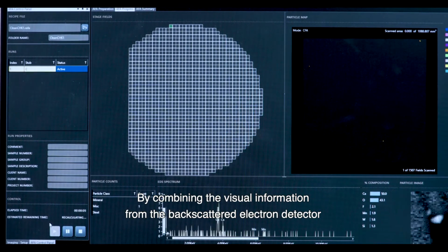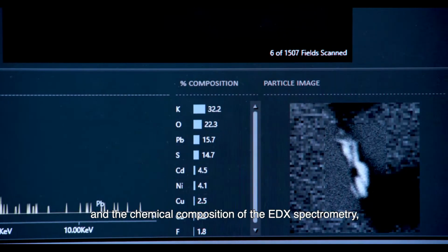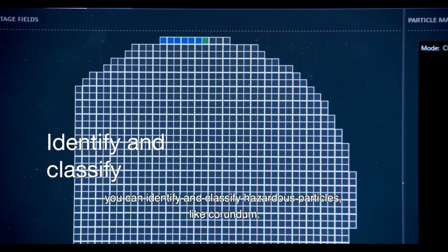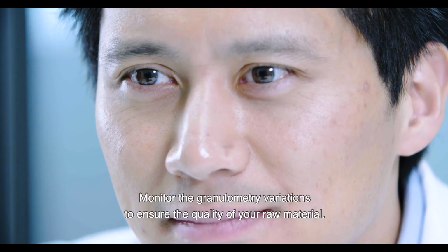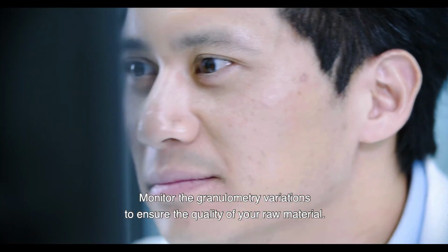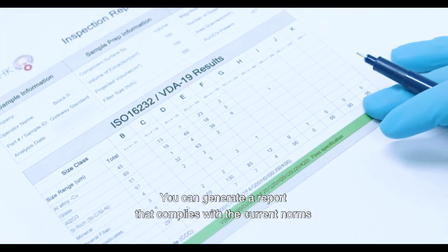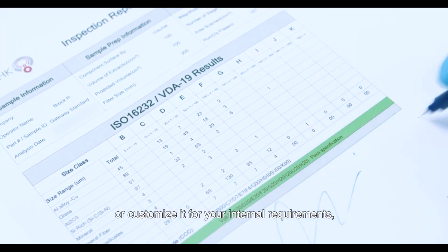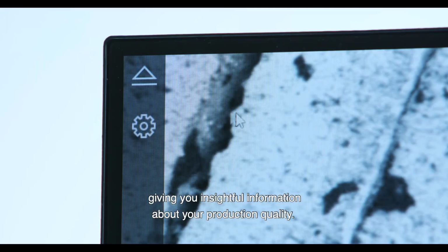By combining the visual information from the backscattered electron detector and the chemical composition of the EDX spectrometry, you can identify and classify hazardous particles, like corundum. Monitor the granulometry variations to ensure the quality of your raw material. You can generate a report that complies with the current norms or customize it for your internal requirements, giving you insightful information about your production quality.